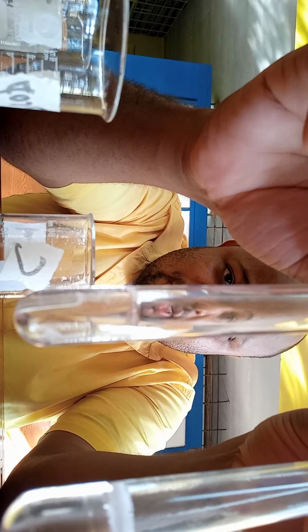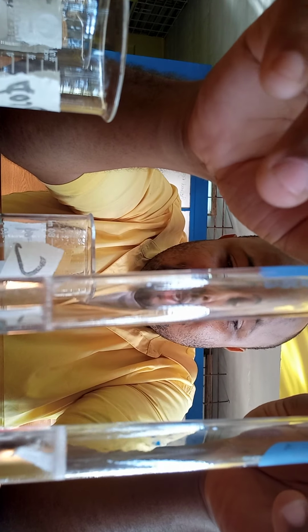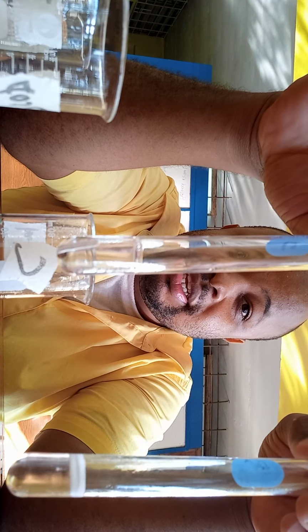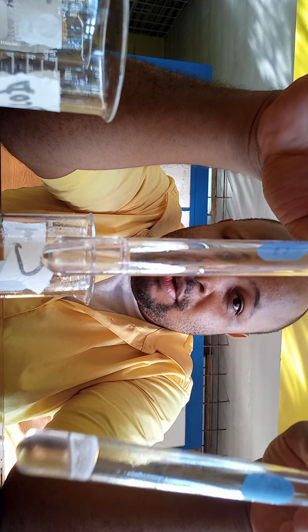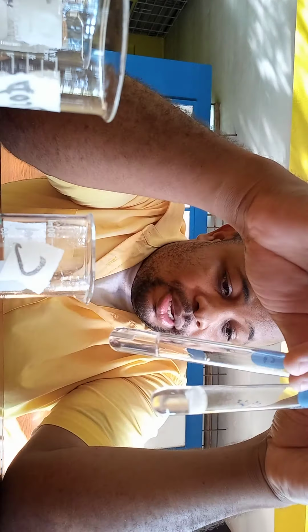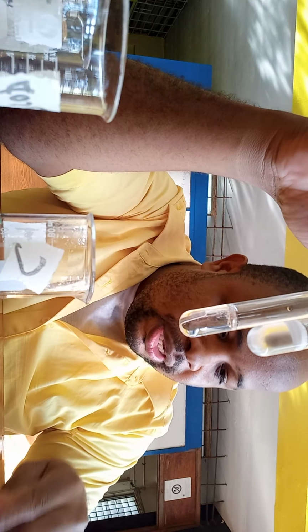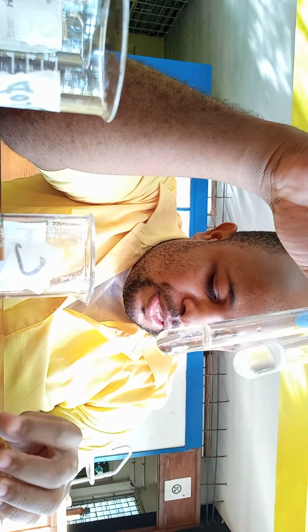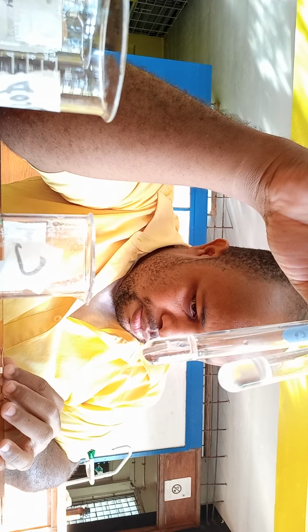So I guess now you can see what would happen if you oxidize a secondary alcohol and the primary one, the litmus paper, oh, they have changed. Well, we mixed them up now, but I think these were them. These were the two of them.